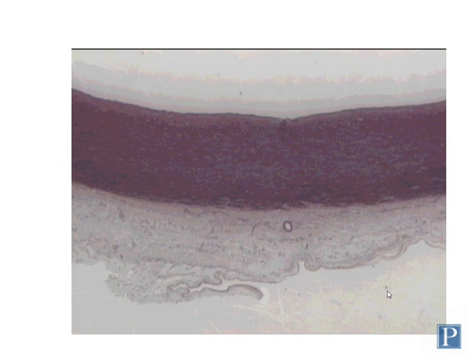Here's a section of a wall of a large artery, and we're only going to look at one large artery in lab, which is the aorta, which is the largest artery in the body. And you can see the large number of layers of smooth muscle here. This is a relatively low magnification view, and this is all the tunica media. Here's the Tunica Adventitia or externa, which is paler and more fibrous in appearance, and then the Tunica Intima is well developed as well, but you need to look at it at a closer magnification to be able to distinguish it from the other layers.